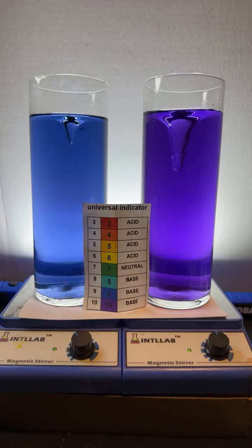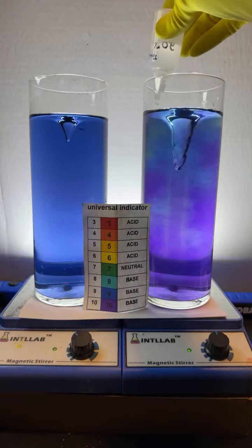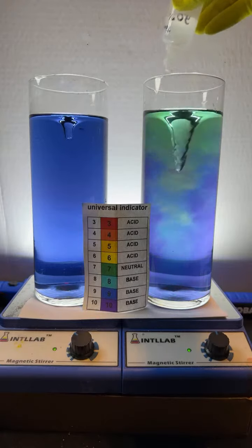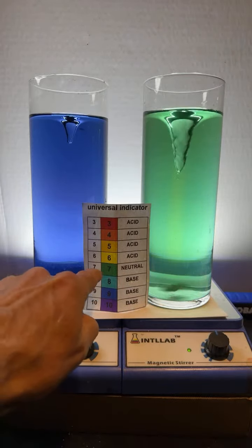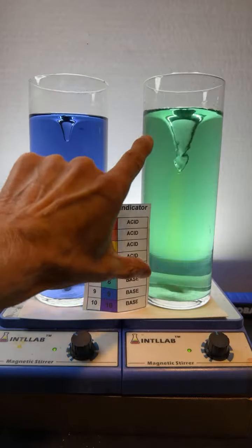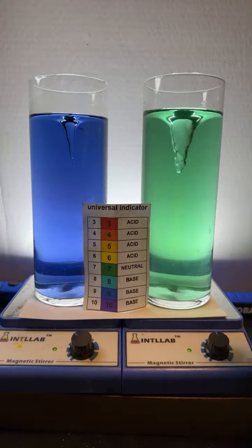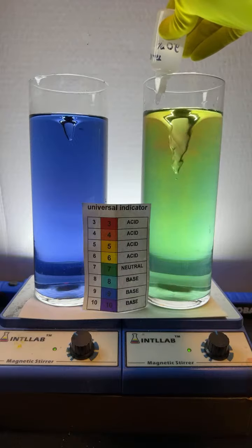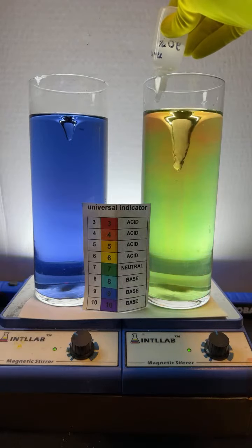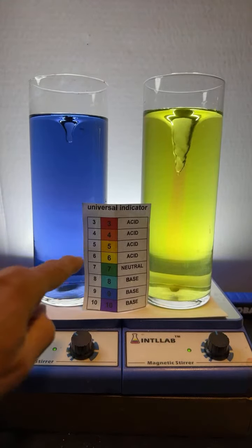And now I'm going to do the opposite. I'm going to add acid to this flask over here. So I'm going to do it right at the middle between the outside and the inside as suggested. And it does look like it's dispersing. But as I'm adding acid, you'll notice that we went from a pH 10 to a pH of 7. In fact, I've added enough acid to neutralize the base. We're at neutral pH. Now watch what happens as I continue to add acid. So here I go. I'm continuing to add drops of acid. And we've gone from neutral now to an acidic solution. It's slightly acidic. It's yellow in color.